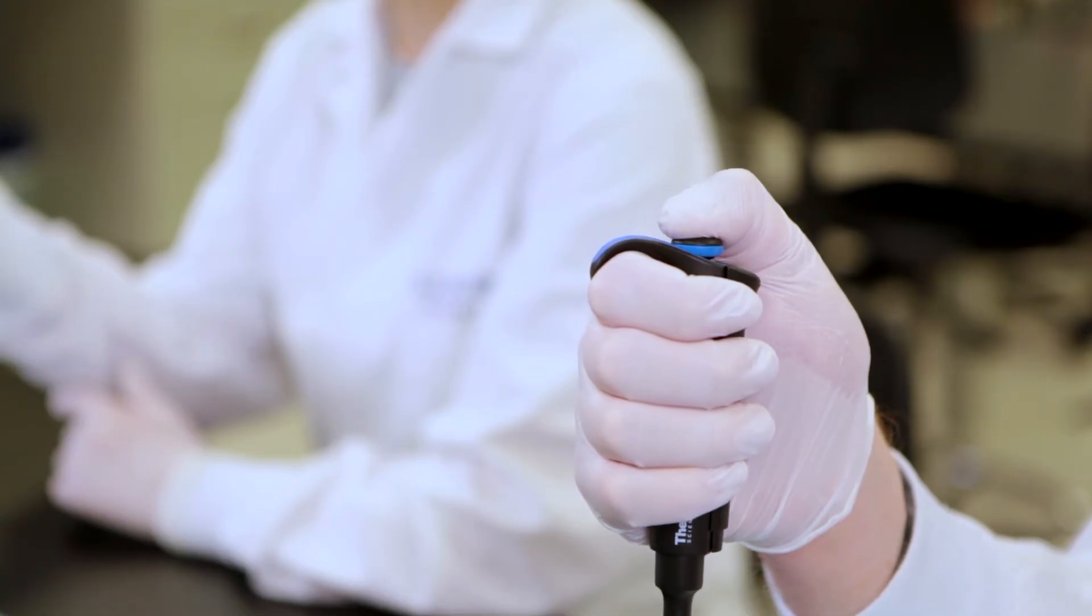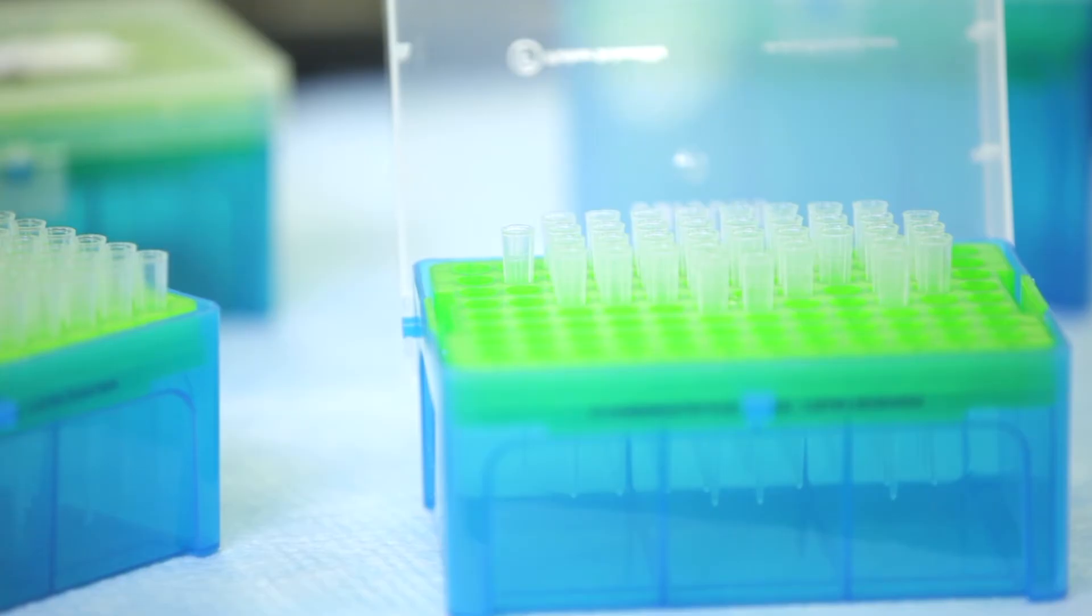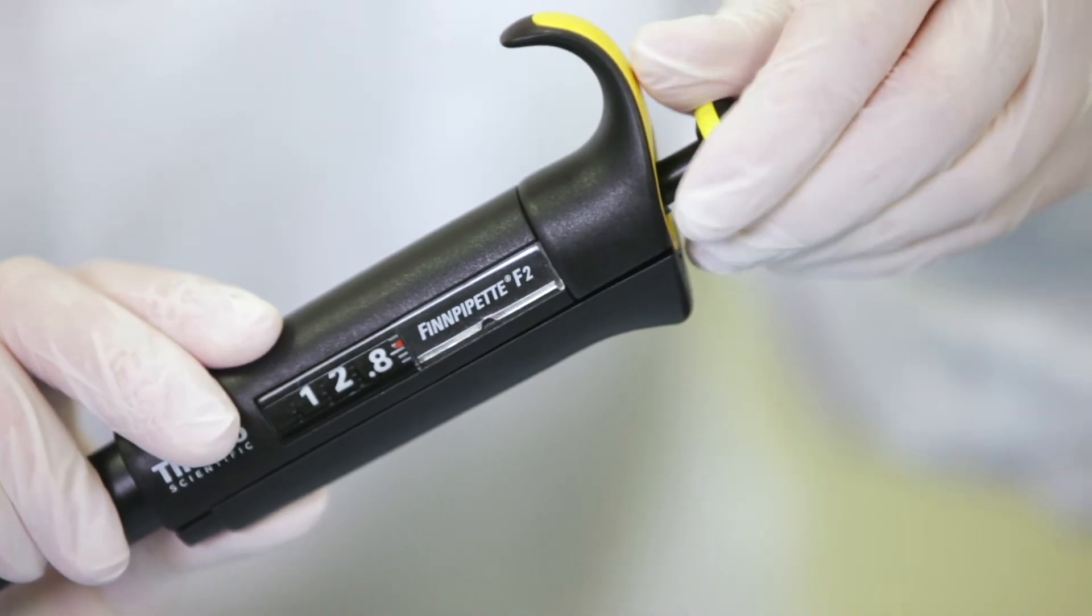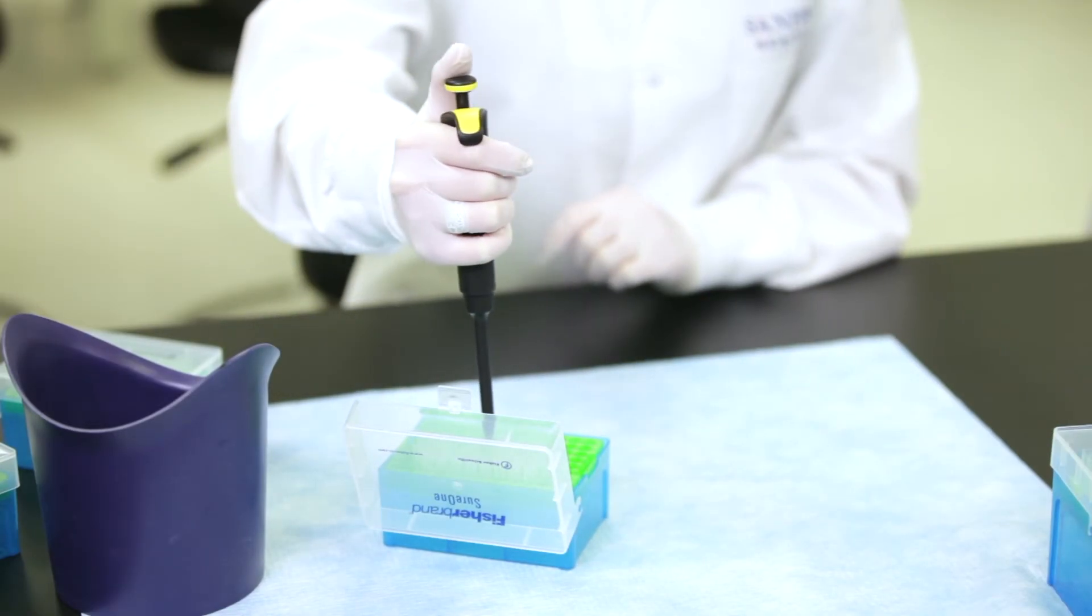To keep your micropipette from being contaminated by liquids and to measure appropriate volumes, you will need a disposable pipette tip. Tips are inexpensive and differ in size and brand to fit your micropipette. Once you set your pipette to the volume needed, attach the appropriate pipette tip to the end of the pipette.